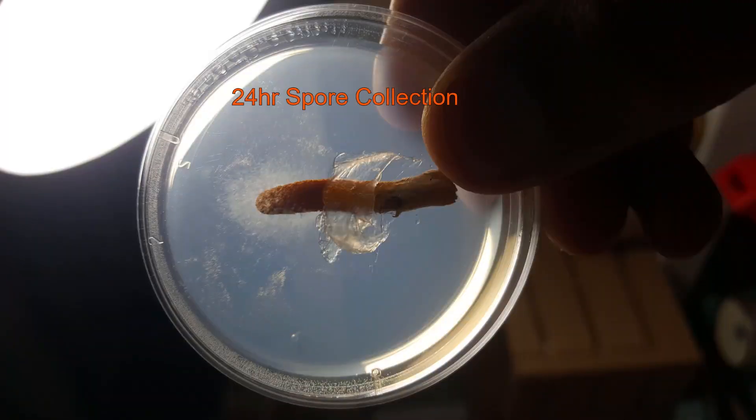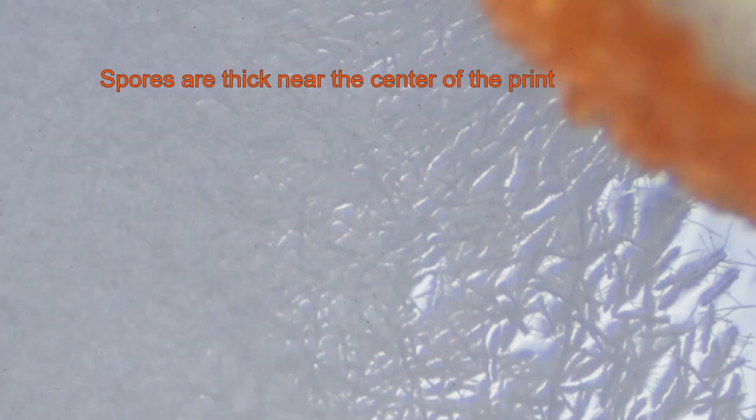So 24 hours later you can see with the naked eye the spores that were shot out of it and in the center of the spore print it's really thick and you won't be able to isolate a single spore.